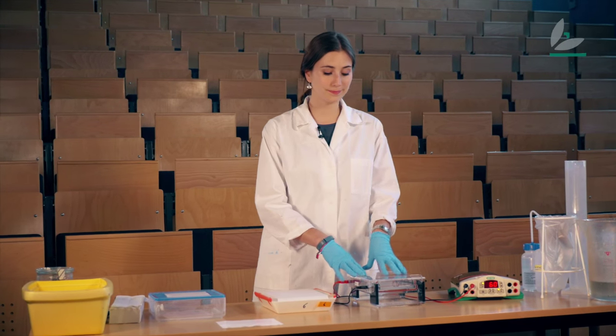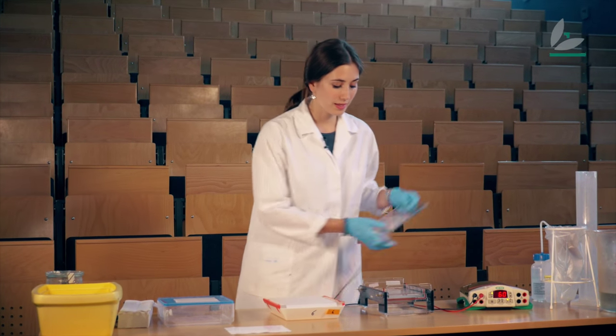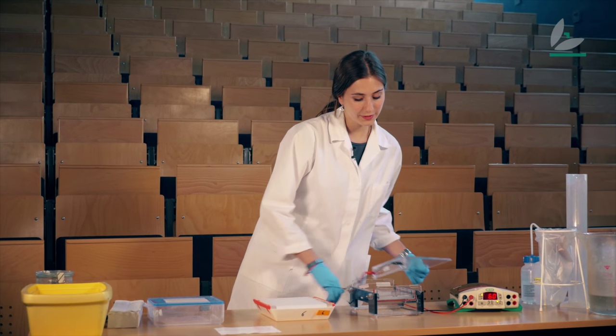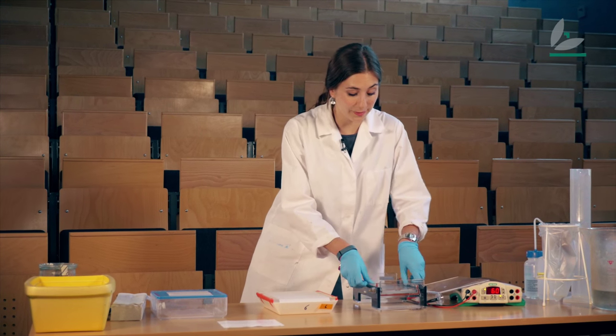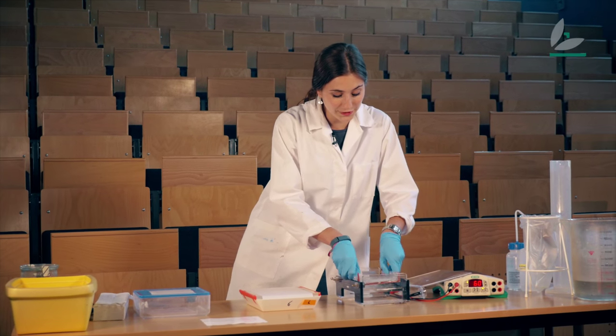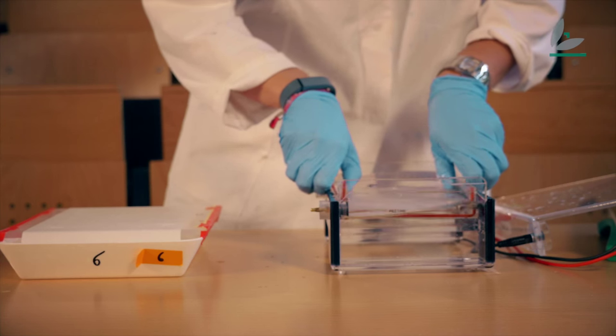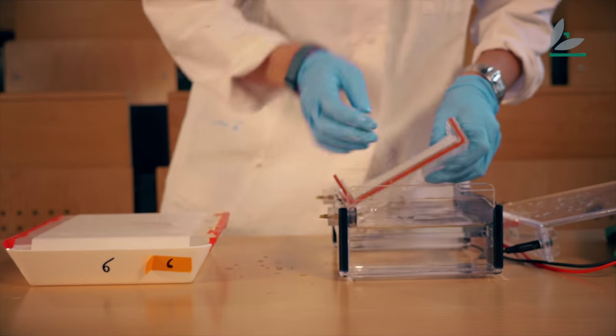So this is what I've done here and now I've separated the DNA fragments by their size on the gel. But in order to detect them, I have to transfer them to a foil.